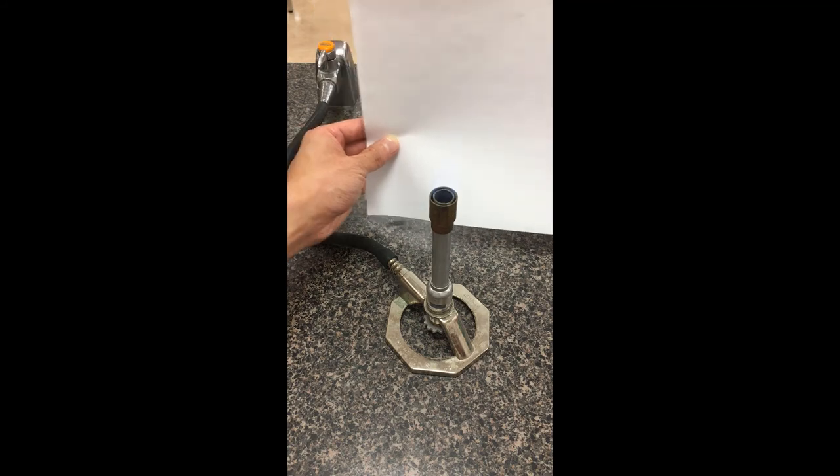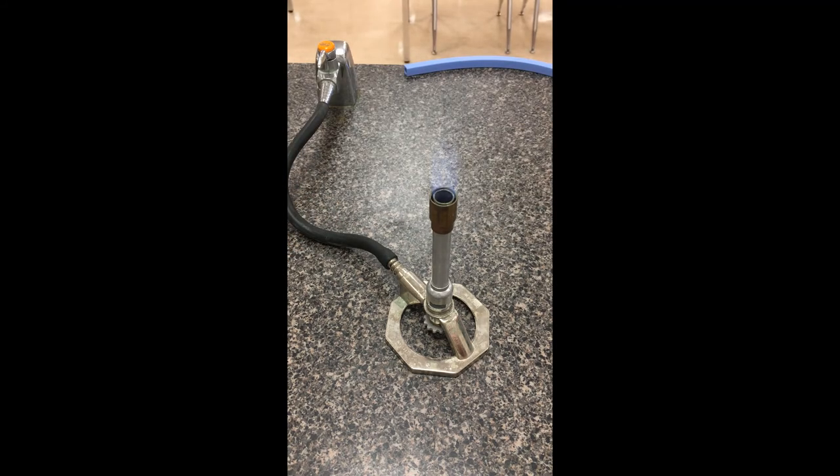As you can see, I'm trying to show you that blue flame. If I accidentally walked away from the Bunsen burner and people weren't aware it was on, it can become a danger — the flame is nearly invisible. So if I needed to step away, it's easy enough to re-strike later: all I'm going to do is flip off the gas. As you flip off the gas, the Bunsen burner goes off, and I can strike it again when I'm ready to use it. If you have any questions, just let me know. Thanks, guys!